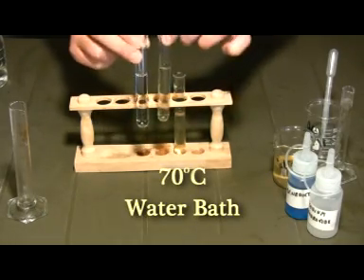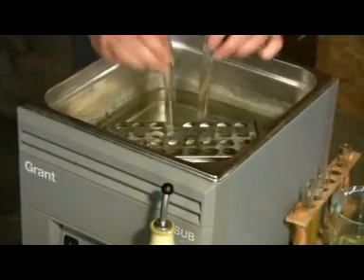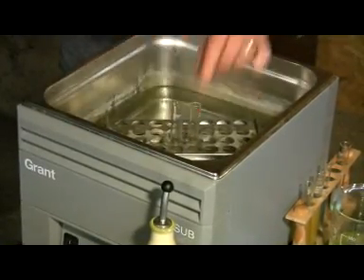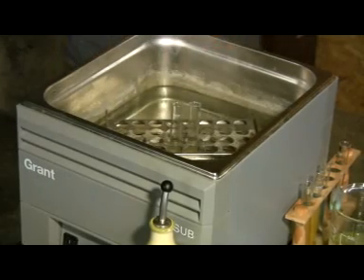We're going to take those two test tubes and put them in the water bath for a few minutes - the test control and the sucrose or sugar solution.